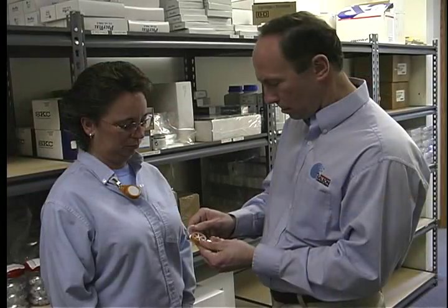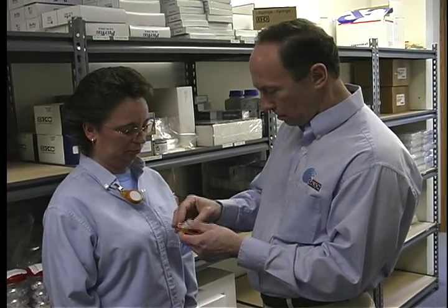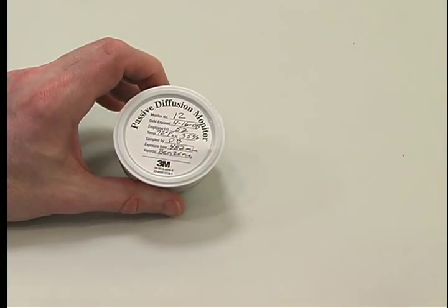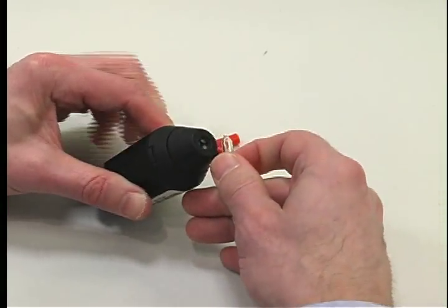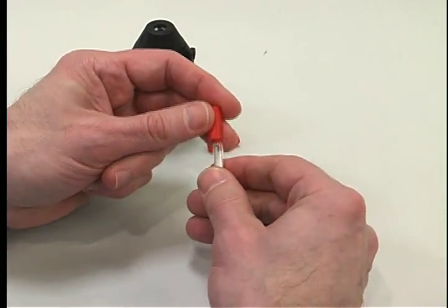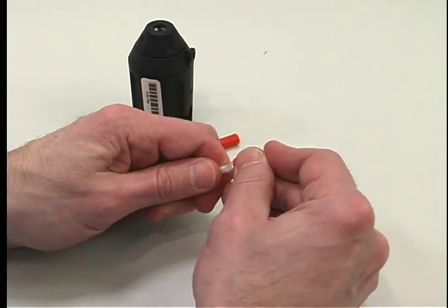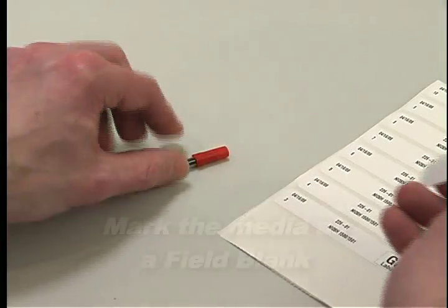A field blank is handled in the same way as your samples — open, seal, store, transport — except during the actual sample period. Do not draw any air through the field blank media. As you are preparing your sample media to begin monitoring, handle the field blank at the same time and in exactly the same way.